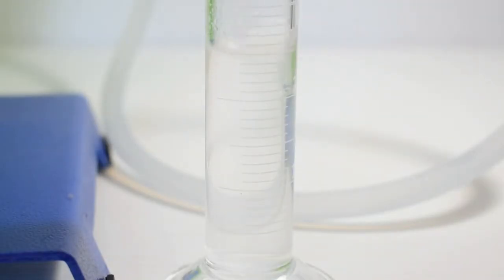These droplets will have to be extracted from the water so that we can have the pure mint oil which contains menthol. If you look very closely, you can even see a thin oily layer on top of the distillate, and that is the mint oil floating to the top because it's less dense than the water below it.